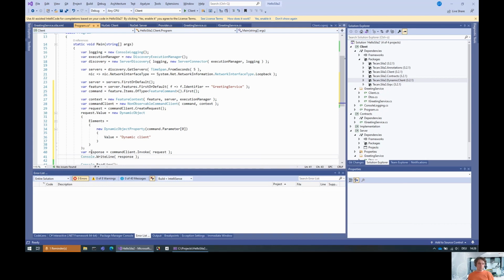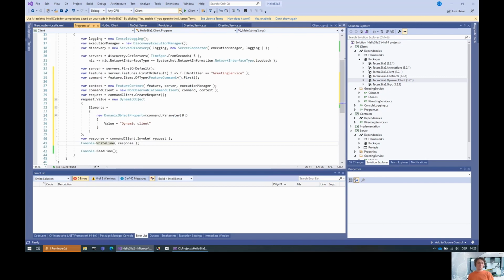So what is the response, by the way? The response is also a dynamic object property. This has a value. This value is going to be also a dynamic object because the command might have multiple responses. So you can actually also investigate the elements and then look for the actual result that you wanted. However, the write line will also work.